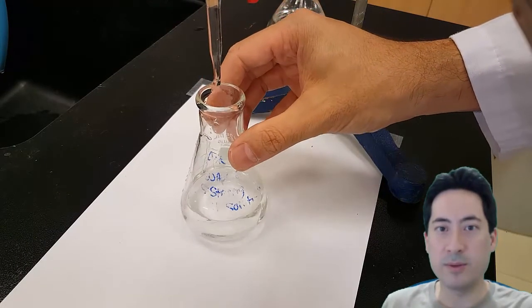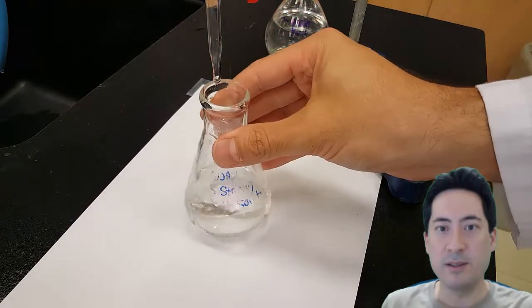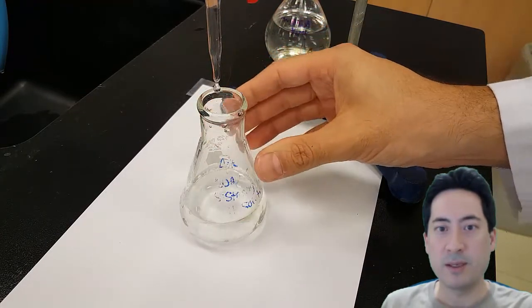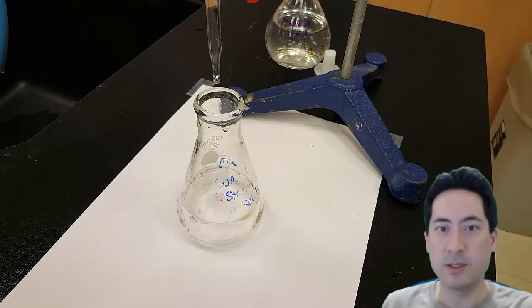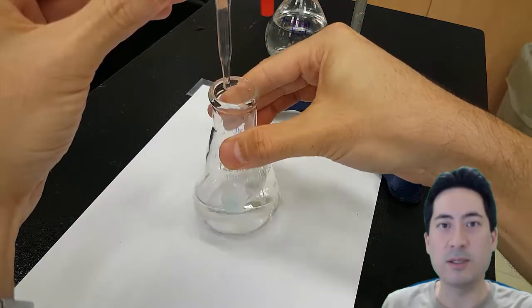You can see I've got about one drop every three seconds right now. As soon as I think it's getting really close, I'm going to have to stop it and do it drop by drop because you must get it to a single drop.